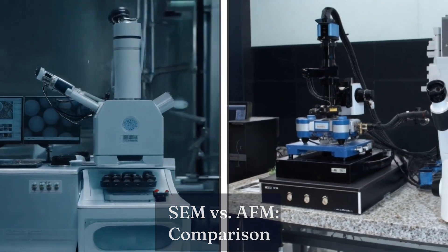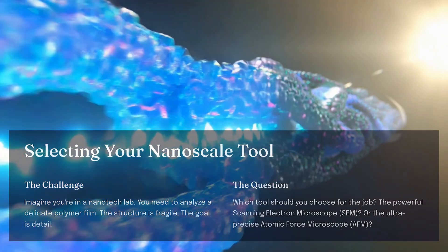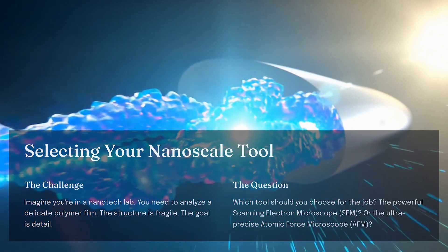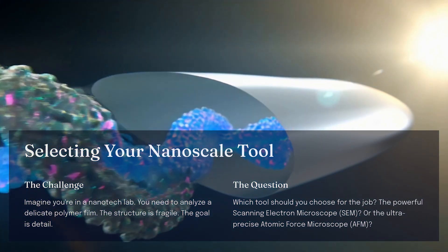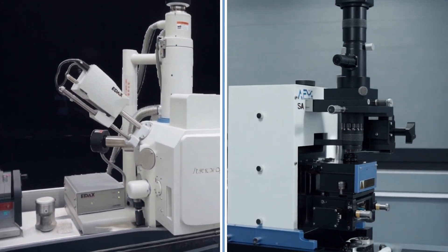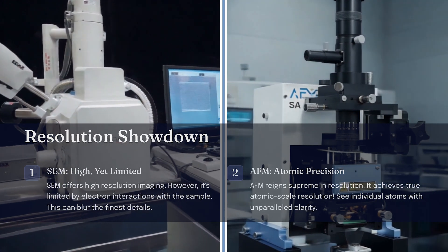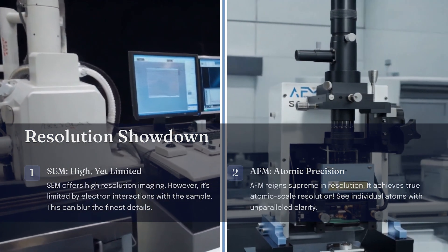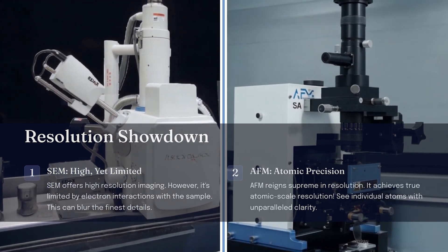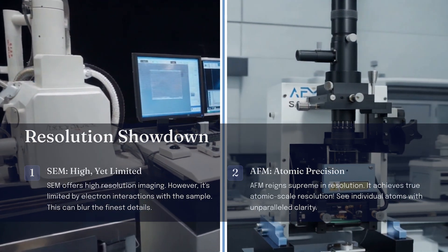Let's directly compare SEM and AFM. Imagine you're working in a nanotechnology lab and need to analyze a delicate polymer film — which microscope should you choose? First, let's consider resolution. SEM can capture details at the nanoscale, but its resolution is limited by how electrons interact with the sample. AFM, on the other hand, offers true atomic-scale resolution, capable of imaging individual atoms on a surface.